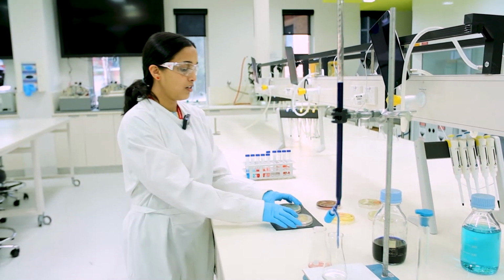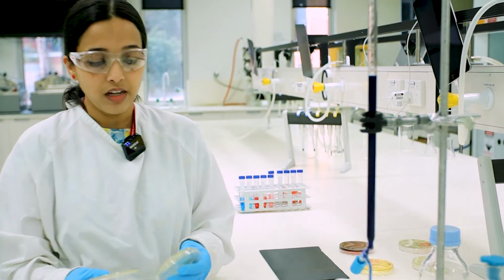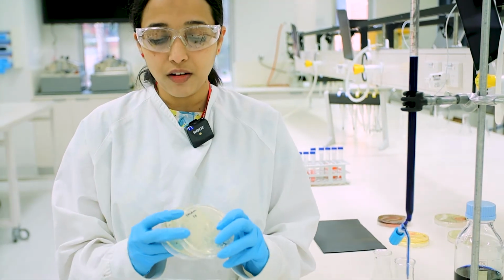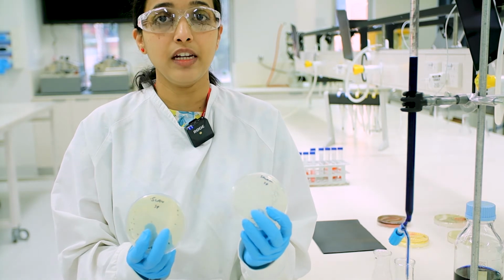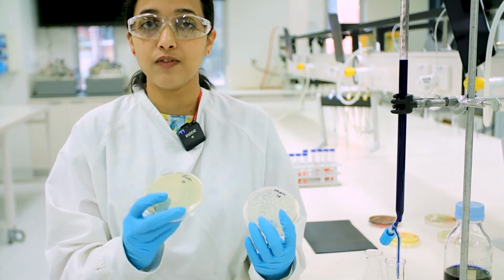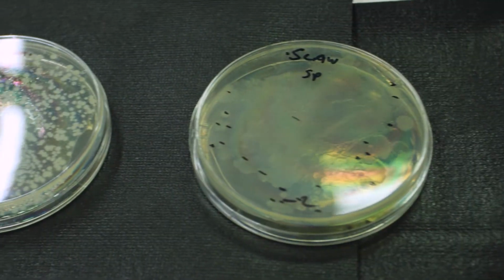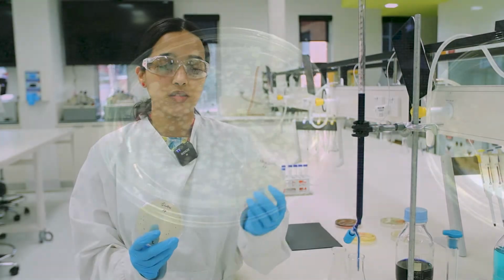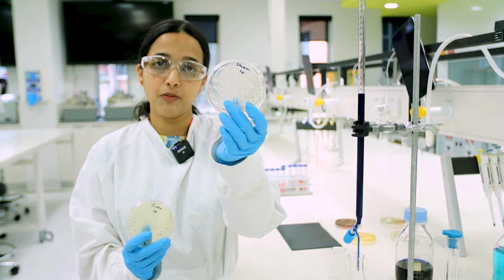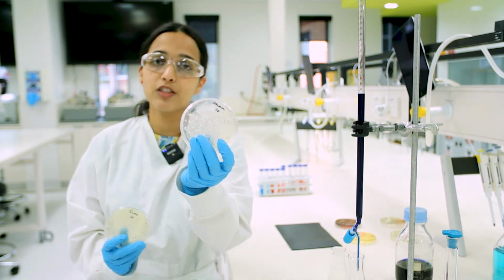Another example I could give you is what our year 2 students do in their laboratory. So here you have foods that are commonly found in your supermarket. So you have salami and you have slaw, and the students were trying to estimate the number of bacteria that are present in these commercial samples. So you can see bacteria growing on the plate, you can count these, and you can talk of the microbial load in these food samples.